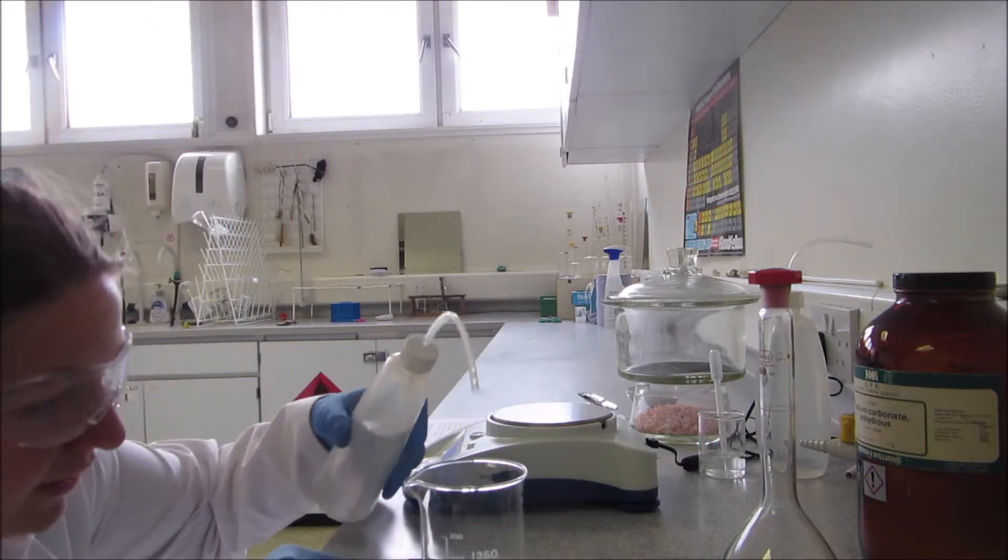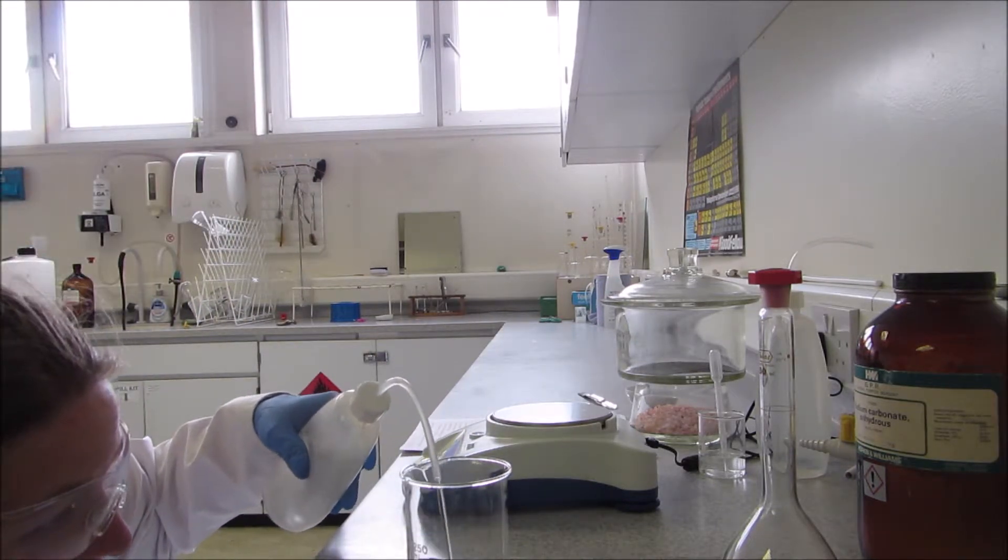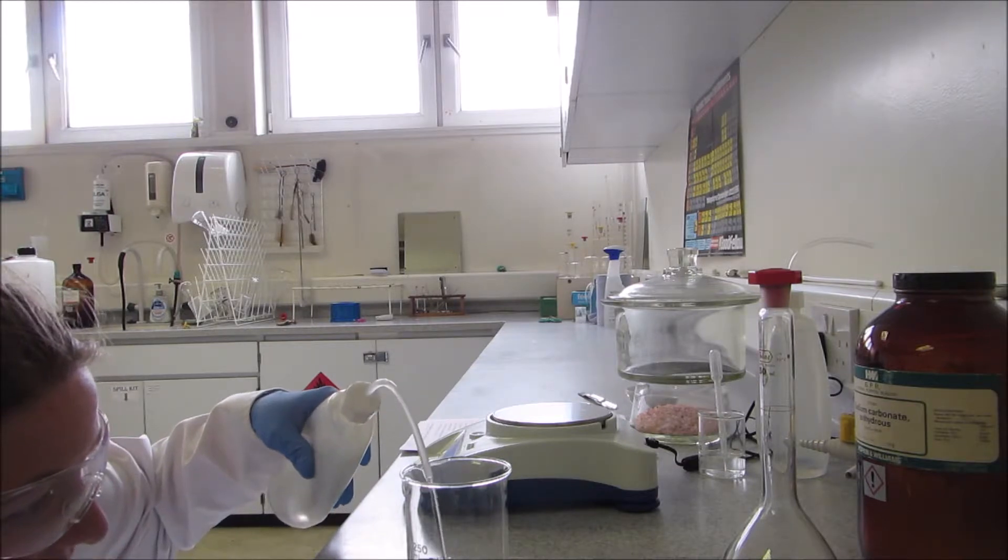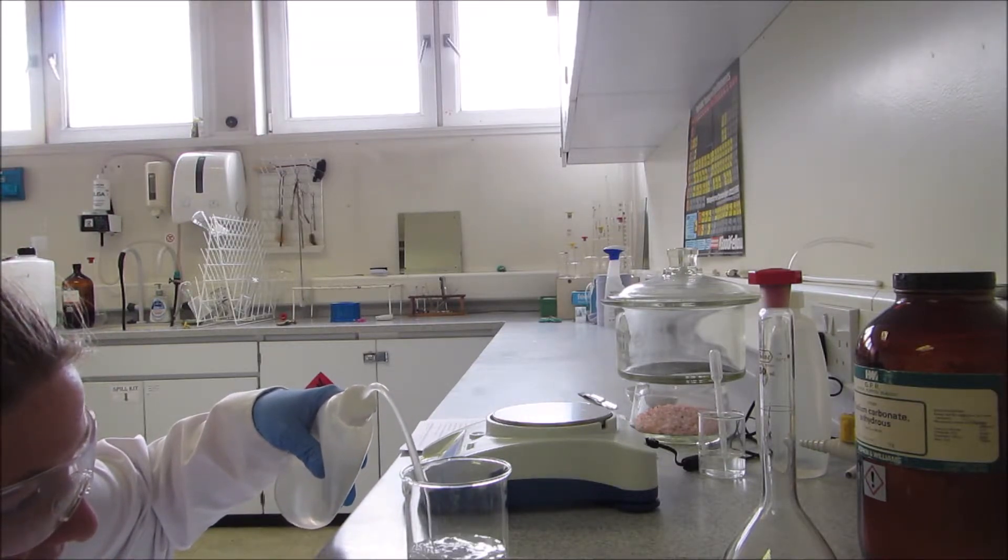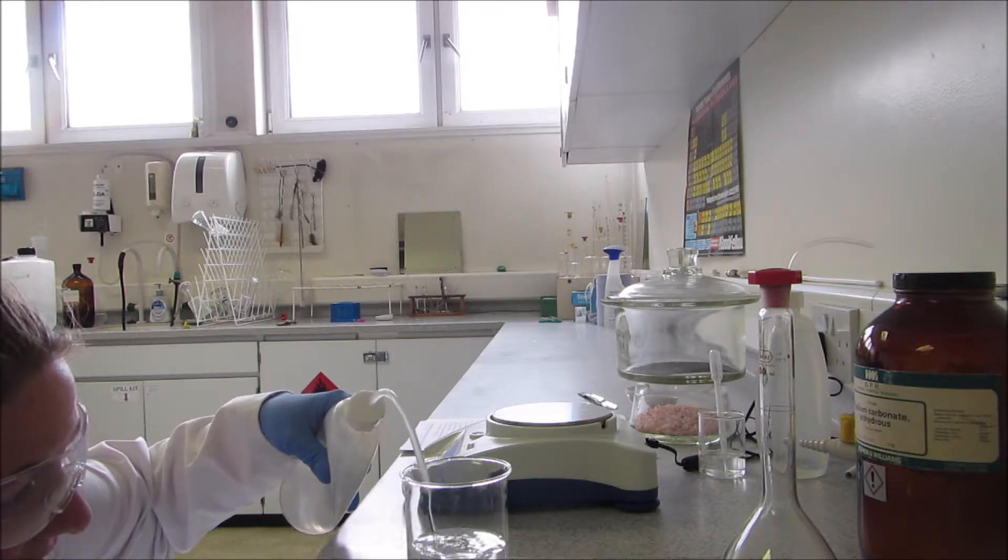I'm just gonna get down and add about 150 milliliters. It doesn't matter if it's a little bit less, but you're better to have a little bit less than a bit more.